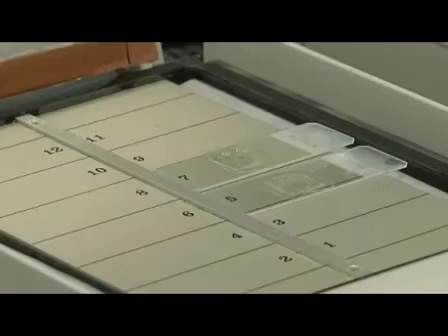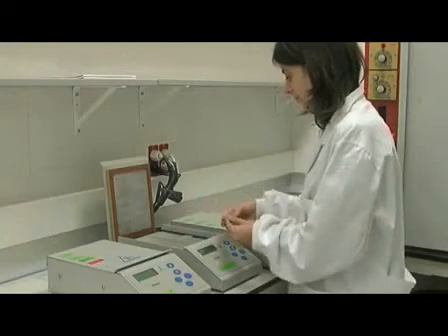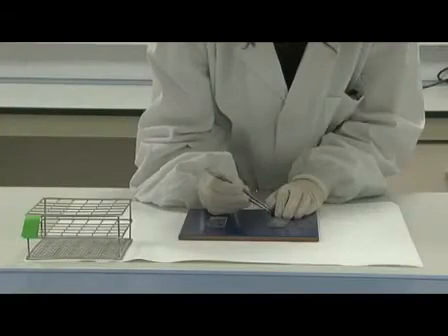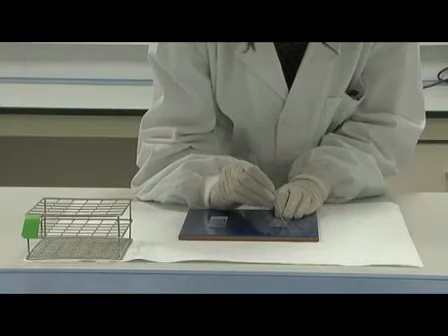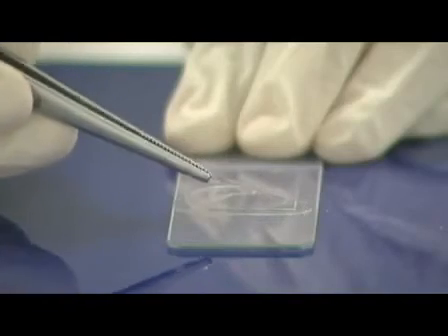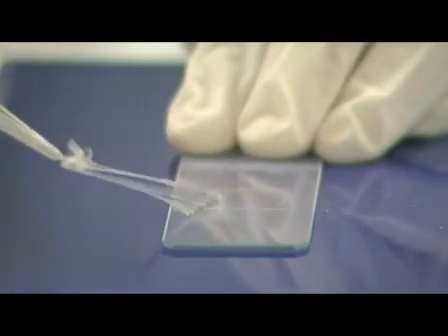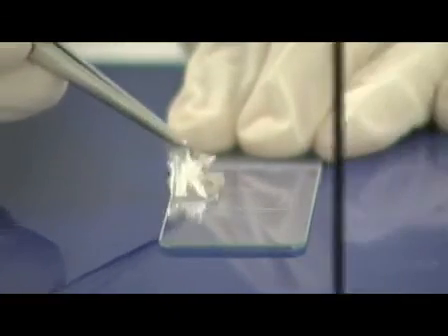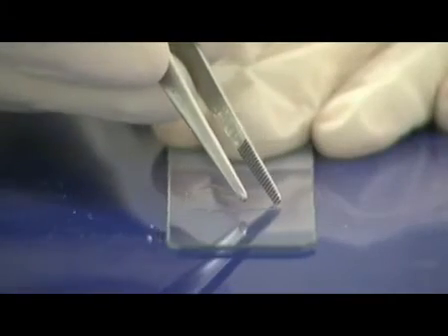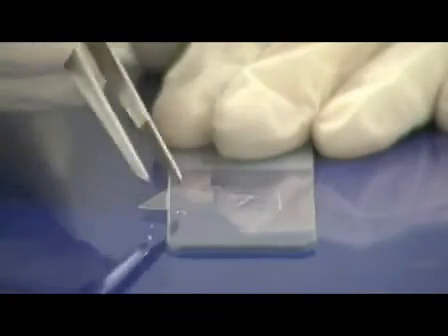After the incubation time, the slides can be removed from the hybridization chamber to eliminate the rubber cement. Then, carefully take off the cover slide as shown.